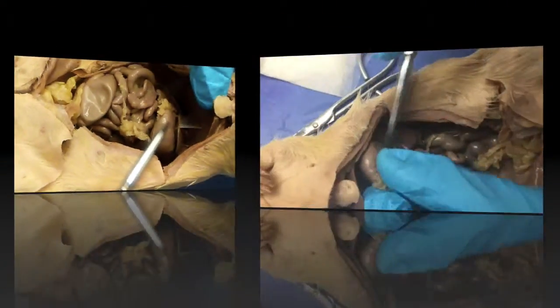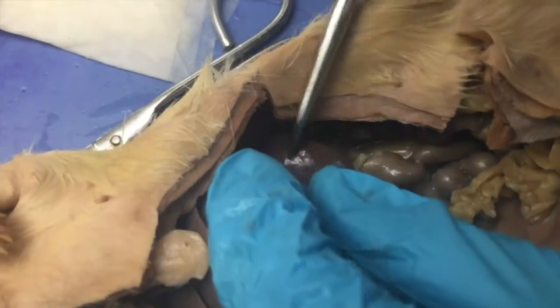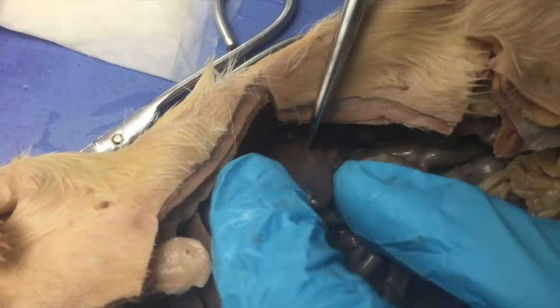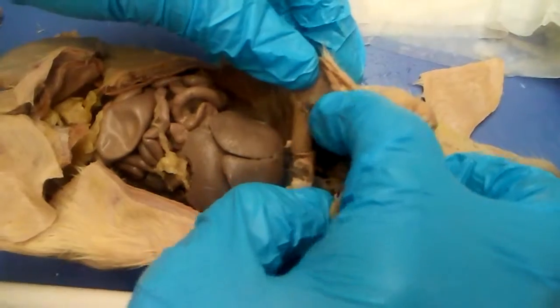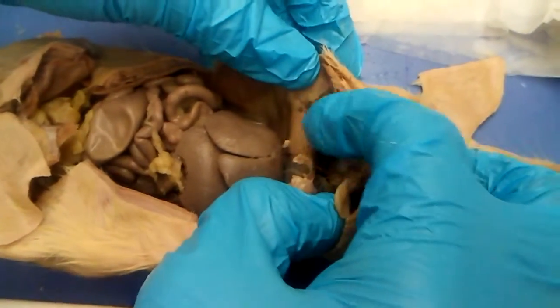From over here you can locate the kidney — it's right here, that's the kidney. The diaphragm is also known as the muscle sheet, and it's right here.